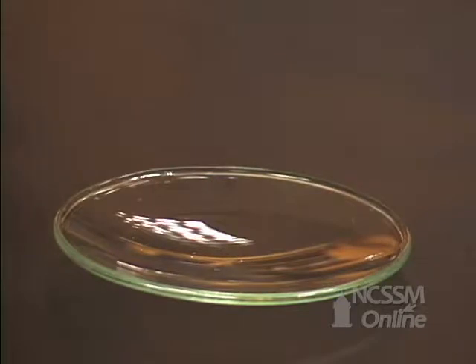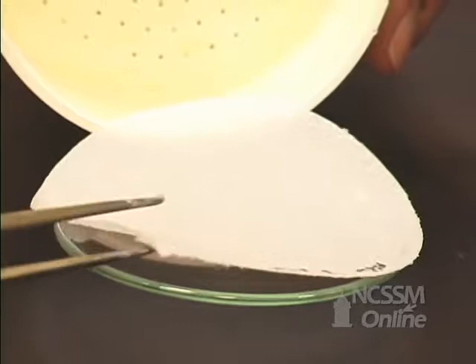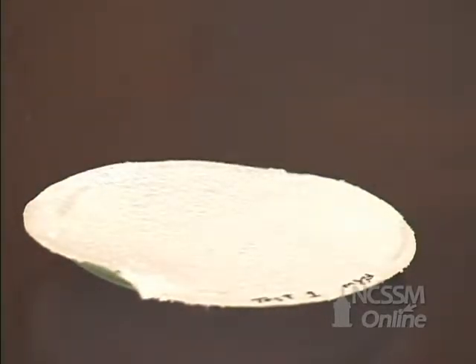Next we want to take out our filter paper with the aspirin on it and set it on a watch glass. Now we have to set it aside and let it air dry.